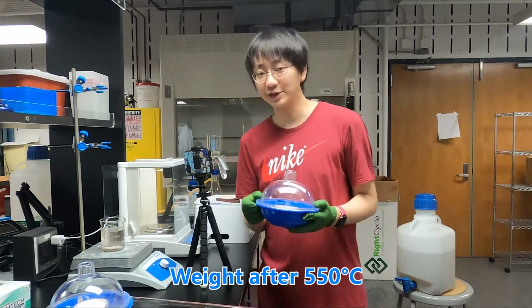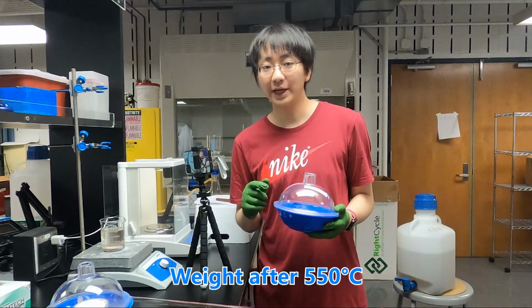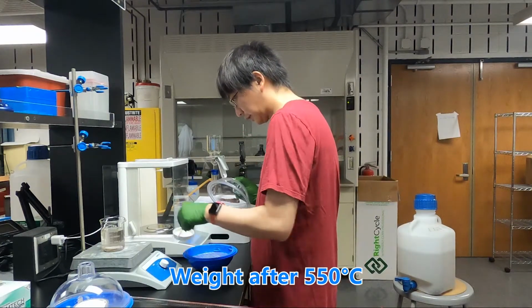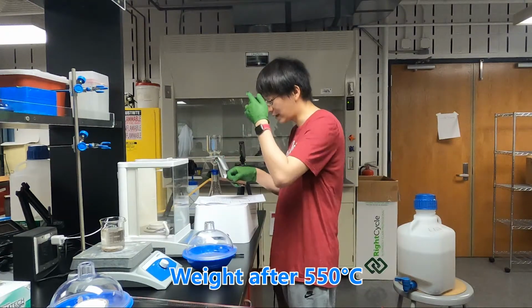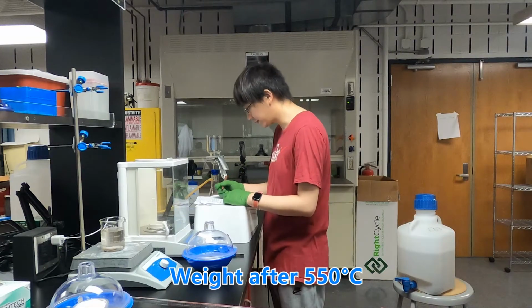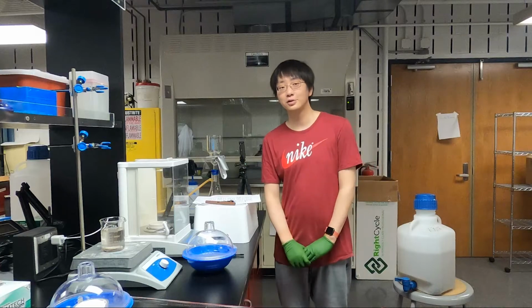And then this dish would be very hot, so we need to wait for 15 minutes. So now it is after 15 minutes. We are going to weigh the mass of this dish, and write down the weight of this dish. So it is the mass after 550 Celsius degrees. So we have the data for the total solids.